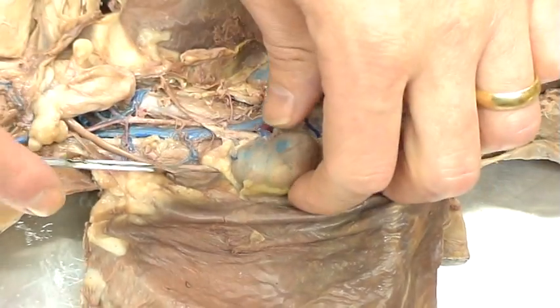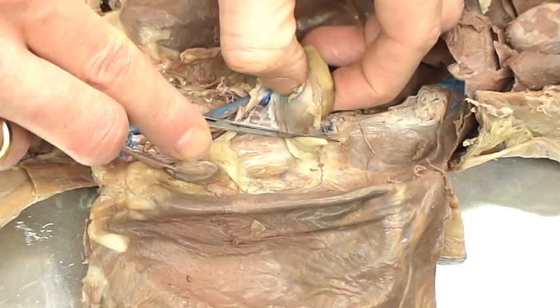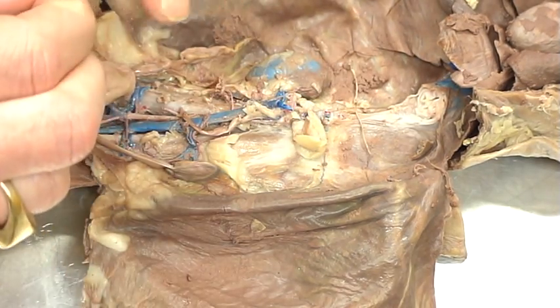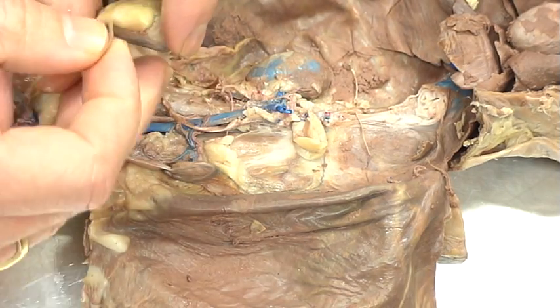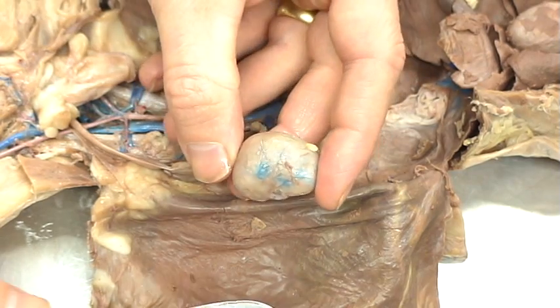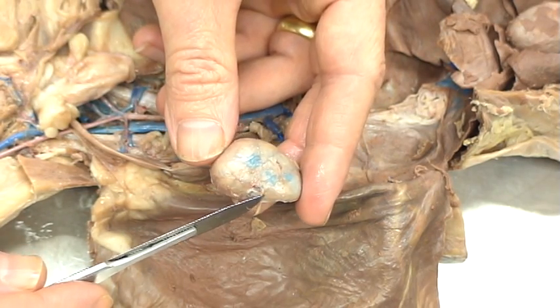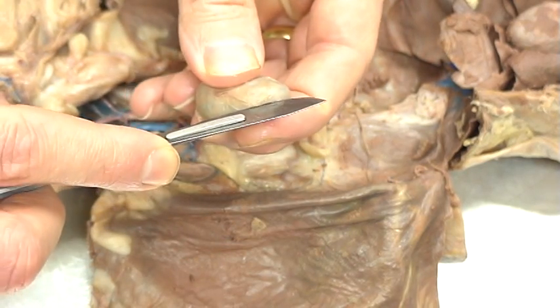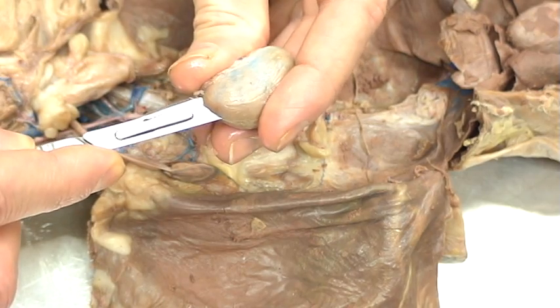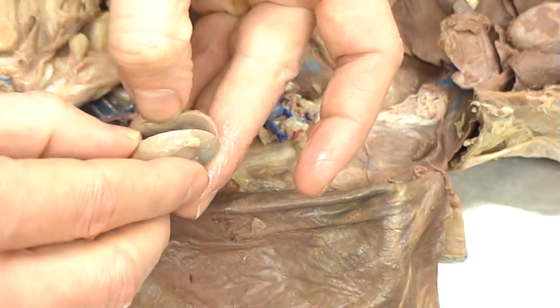What we do for this dissection is we actually lift out one of the kidneys — it's in a little sack, protected by a mesentery. We'll lift that out, cut off or shave off the suprarenal gland, cut off the blood supply, and open up the capsule. It looks like a kidney bean, and the name kidney bean is based off of that. Here's where the blood supply came in, and this is where the pelvis is. I'm going to flip it to the lateral side and make one long, consistent incision — not cutting it completely in half, but enough so that it folds open. Hopefully we should be able to see some of the structures inside.